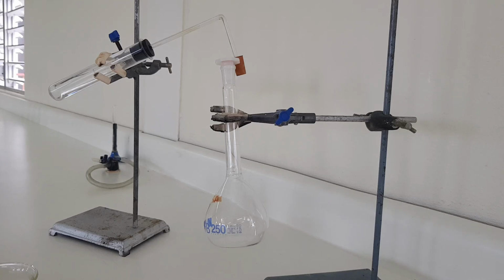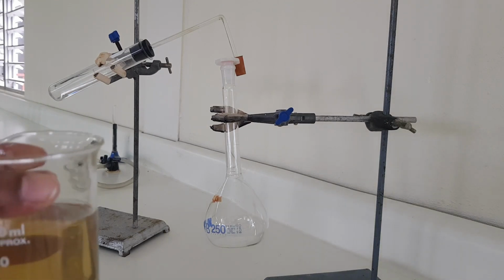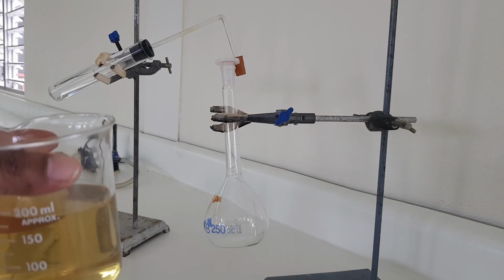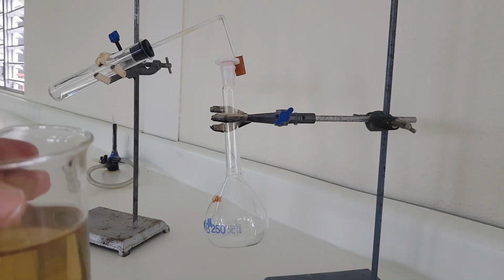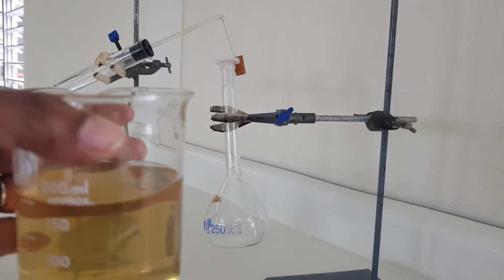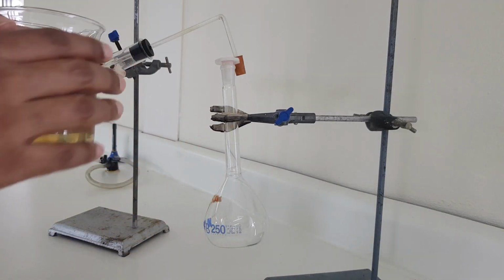Alright, so let's begin to determine whether yeast gives off carbon dioxide during anaerobic respiration. So we have our boiled 250 cm³ of water here with our sugar already dissolved in it. It has been cooled, so I've already removed the protective covering from this. So I'm going to pour this into our flat bottom flask.